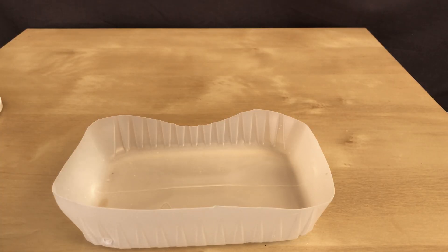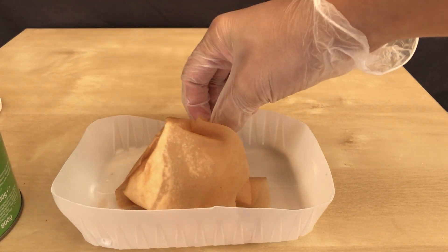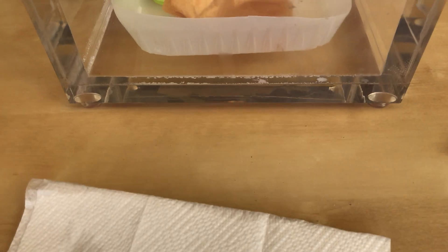We are now left with a damp mass. This was placed into a plastic tray alongside a cup filled with anhydrous calcium chloride to act as a drying agent.